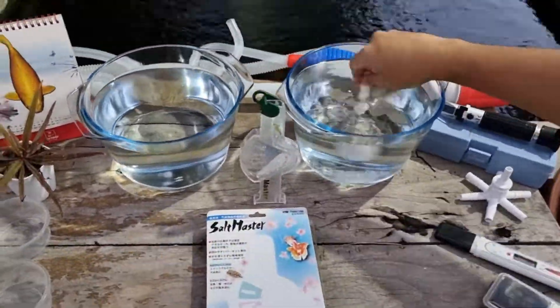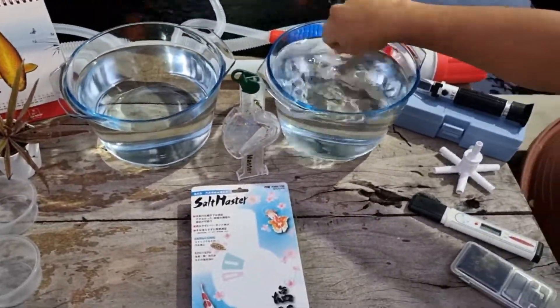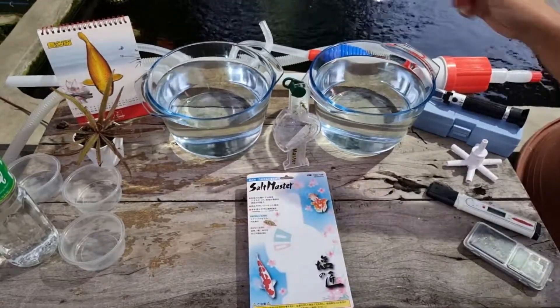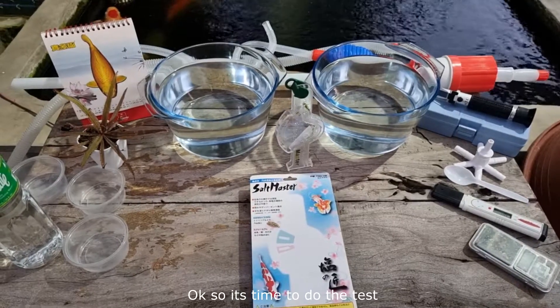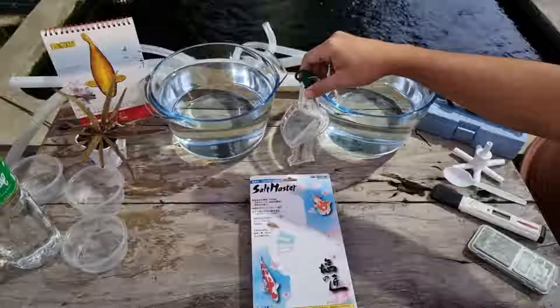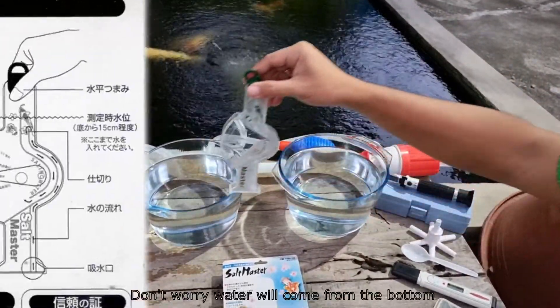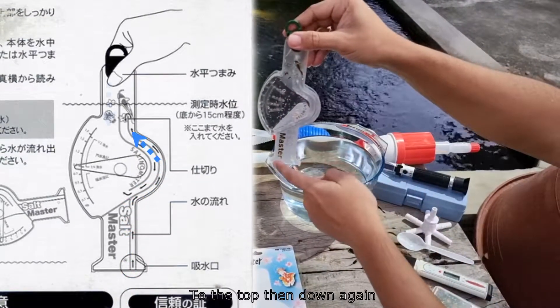Okay, it's time to do the test. We'll start first with our 3 parts per thousand bowl. To use this equipment, you have to dip it in the water in a vertical position — dip it like that. Water will come from the bottom to the top and then down again.